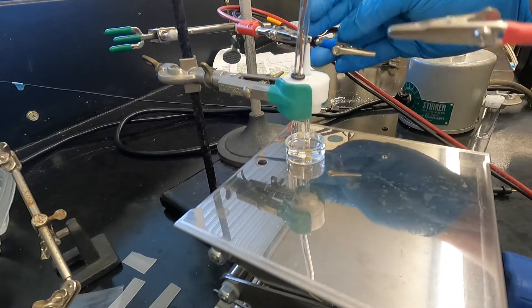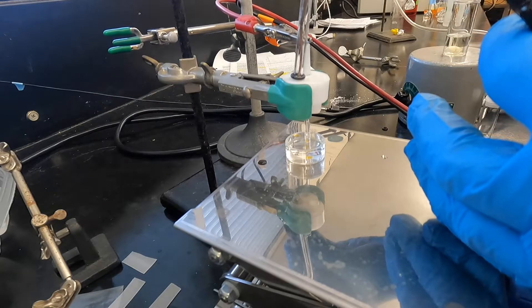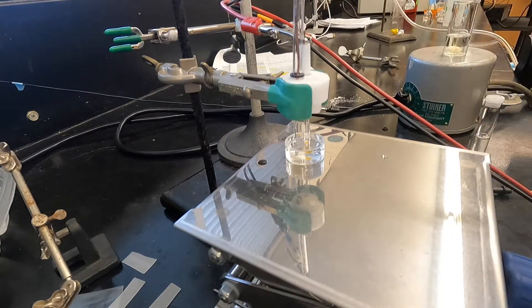And then you're going to grab your other two electrode lines, that is counter and reference, and hook them up to the counter electrode.